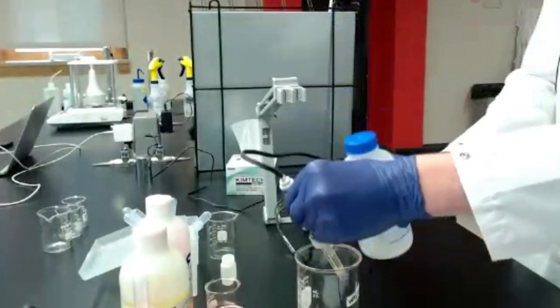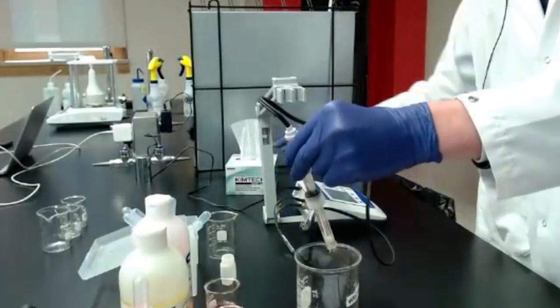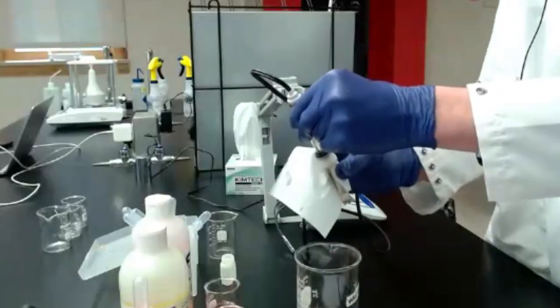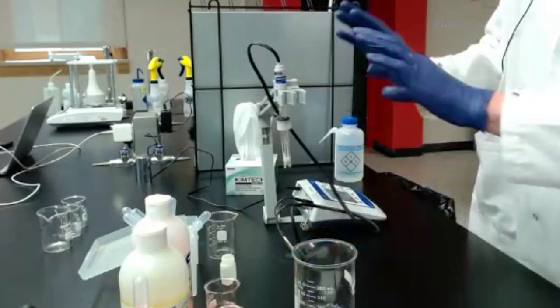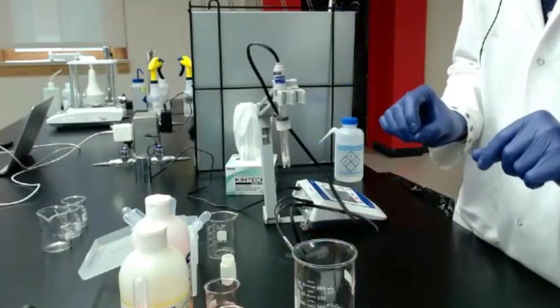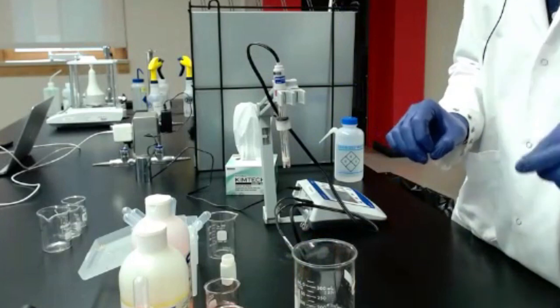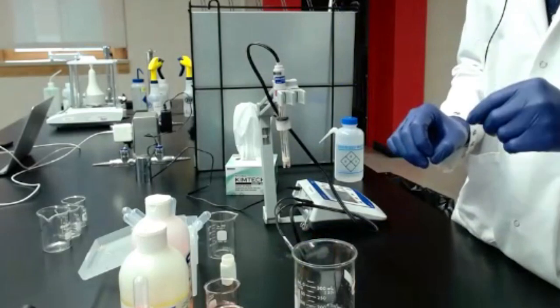I'm going to go ahead and give it another rinse here just to make sure we're good and clean. Get all those potassium chloride crystals off of there. All right, so my pH probe is set up. My pH meter is on. First thing I want to do if I'm going to measure pH is calibrate my pH meter. They do drift quite a bit during storage, even if you just used it yesterday. Try to calibrate it every time you use it.